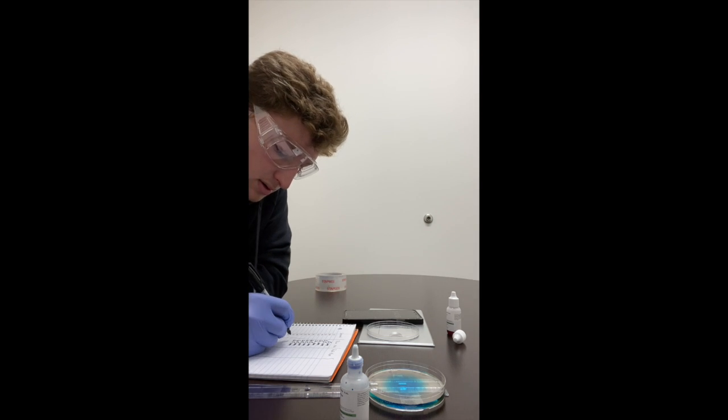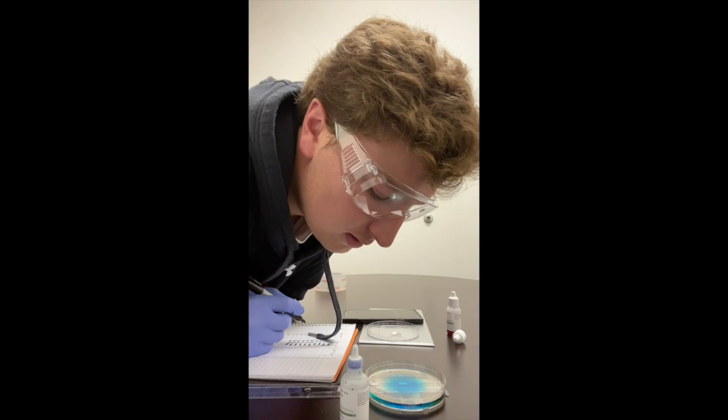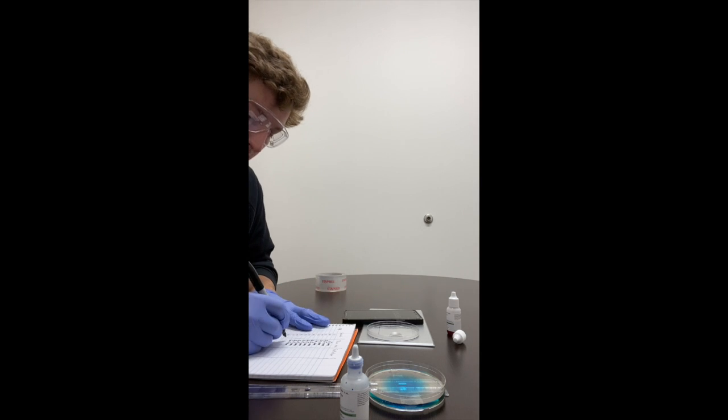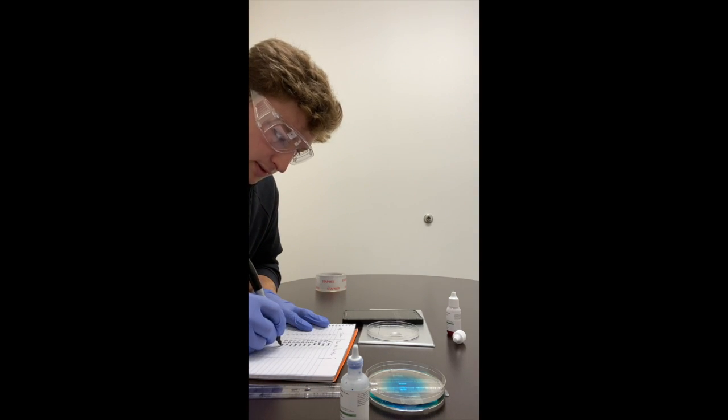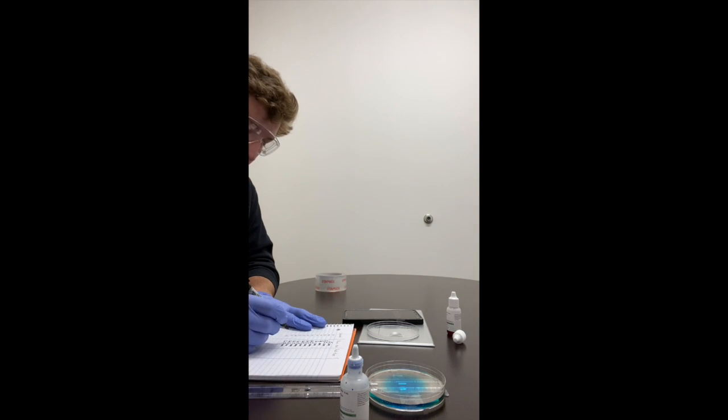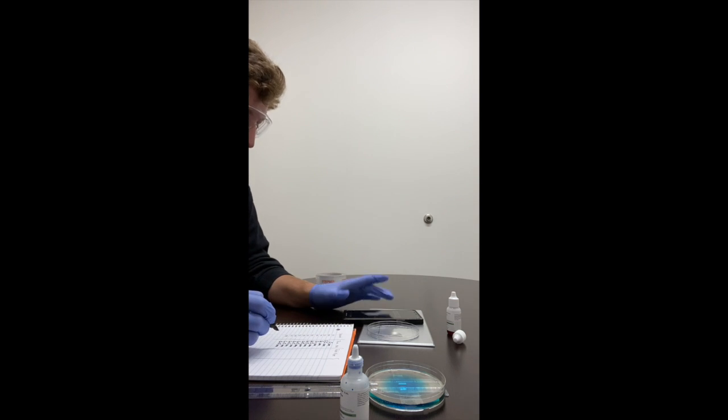At 100 seconds, it is still 6.5 centimeters. 110, it is still at 6.5 centimeters. And at 2 minutes, it is still at 6.5 centimeters.